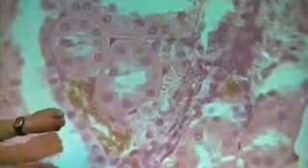All right. Where this one, you see here, hardly anything in that tube, right? And this is a distal convoluted tubule, so it lacks those microvilli. Okay? So, proximal convoluted tubule has microvilli, distal convoluted tubule does not. And I just want to point out that this is a tube cut this way, okay? Where this is a tube cut this way. That's not the difference here. The difference is what's in the middle of the tube. Okay? So I just wanted to point that out.